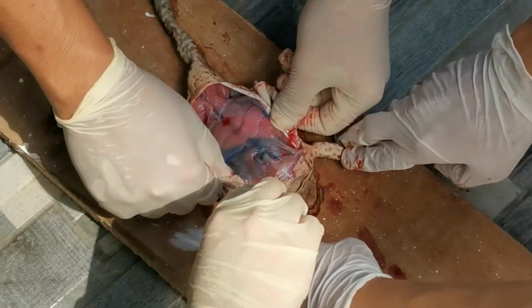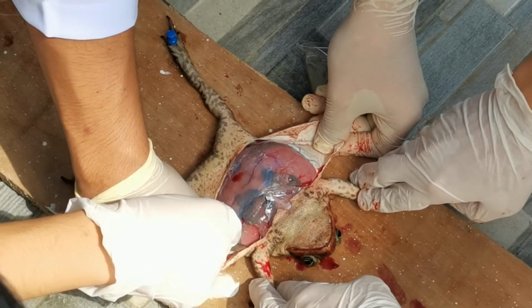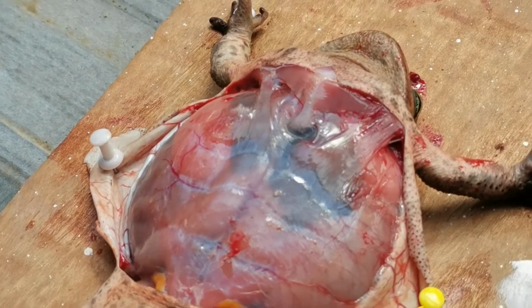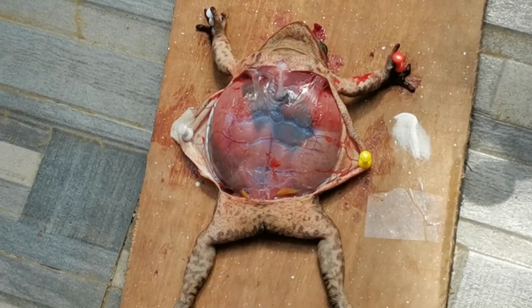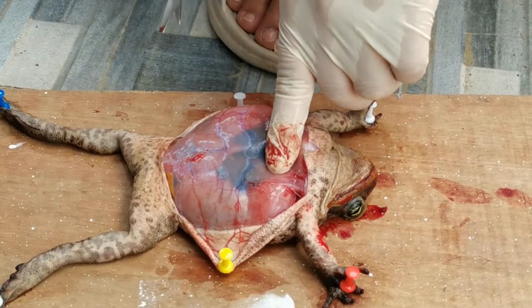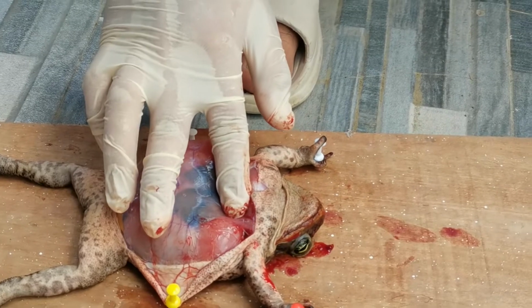In the chest region, you will have to cut through the breastbone. Again, make right angle cuts from each end of the long incision. Fold open and pin down flaps of the skin and body wall. Make additional cuts in the breastbone to expose the organs in the upper body. The sex of the frog is readily noticed once the internal organs are exposed.